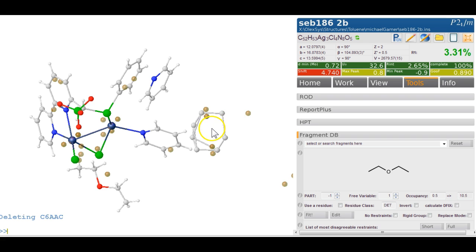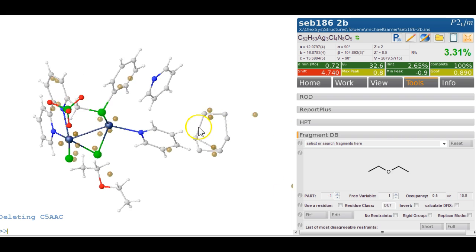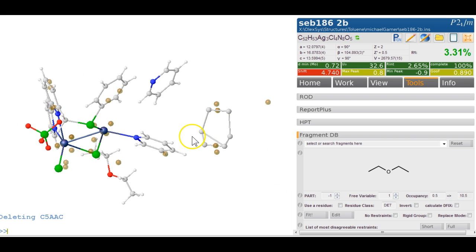So we just delete that one, and we delete that one. It's not a nice one. It doesn't look like a very nice 6-membered ring at all. But let's just start with this and see where we get to. So we select all of those, Control Q to get rid of the peaks.